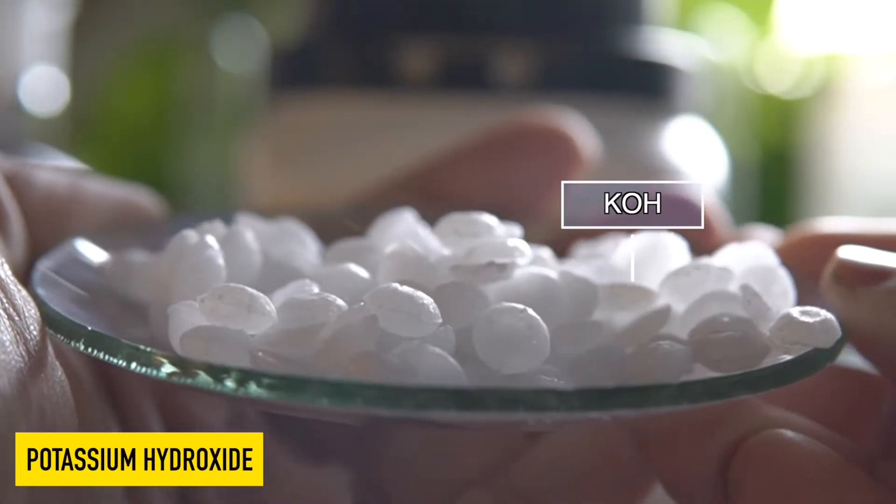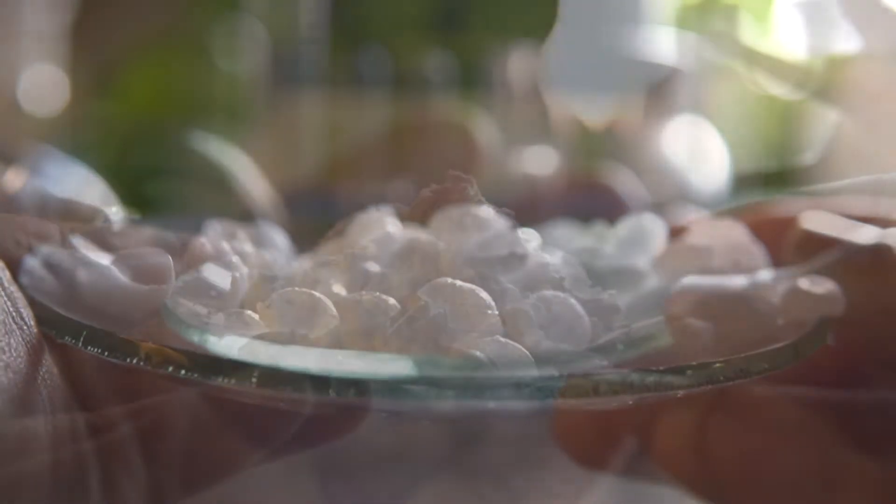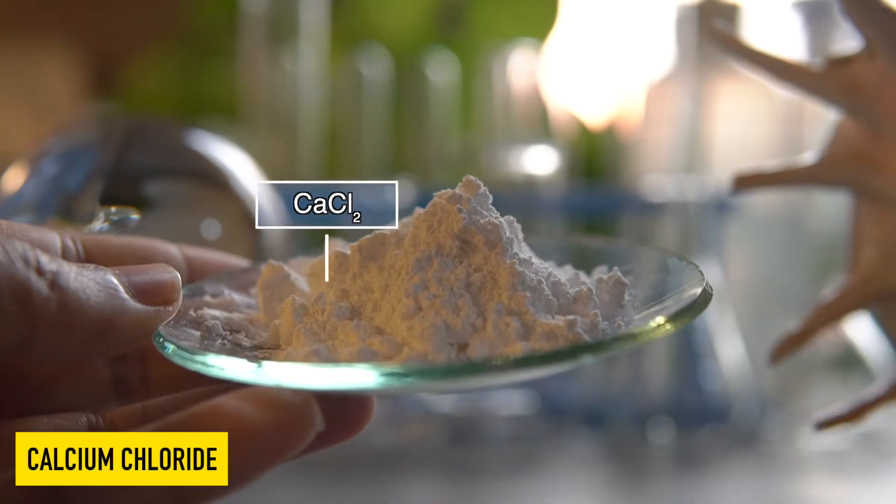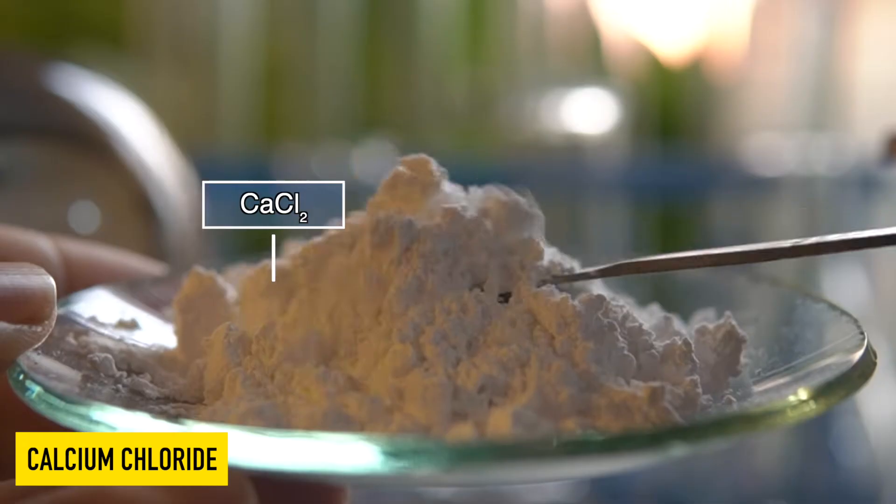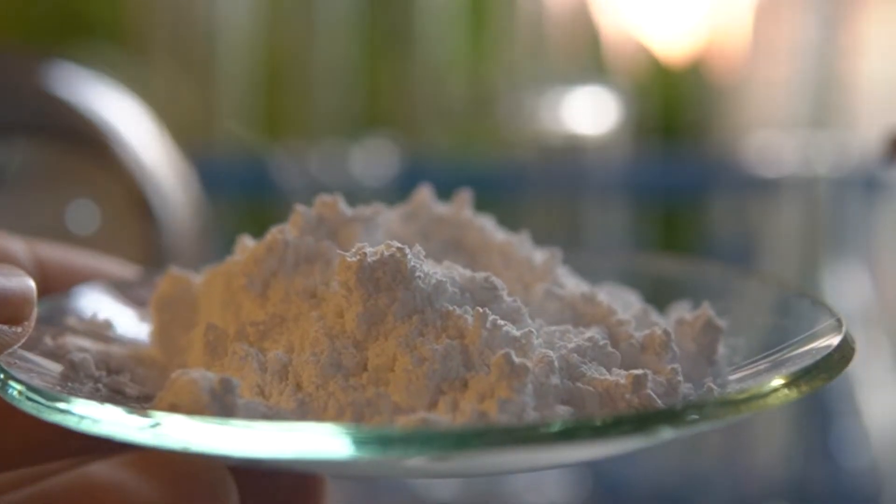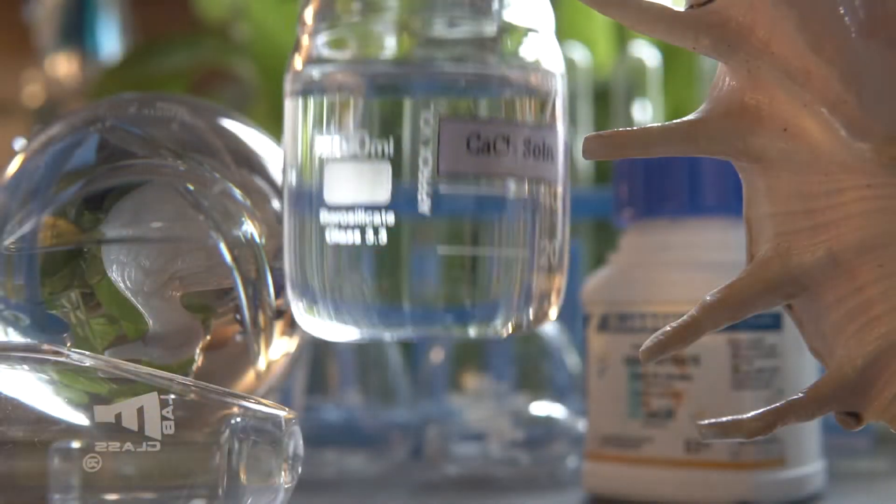The reaction with water is highly exothermic in nature. This is calcium chloride, a white hygroscopic powdery substance that can easily dissolve in water to make aqueous solution.